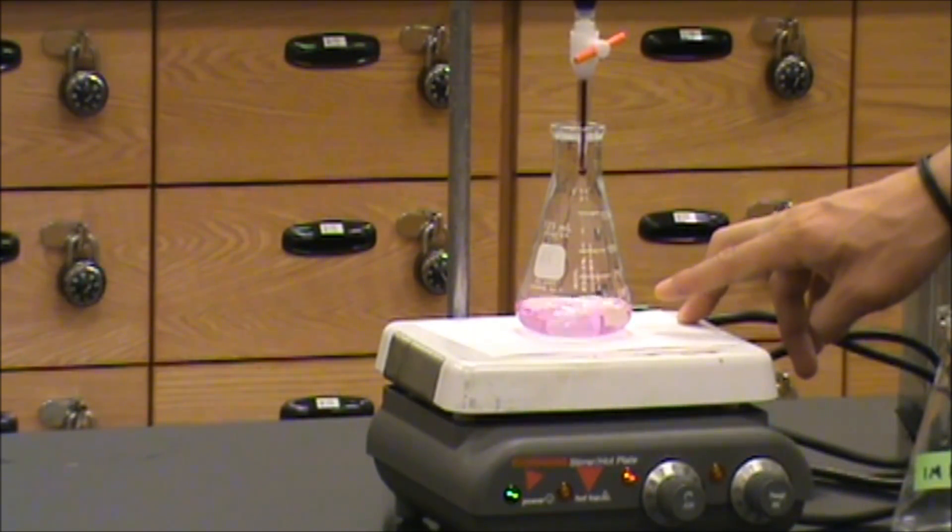At this point, you want to record the volume on your burette. And make sure you record that in your lab notebook.